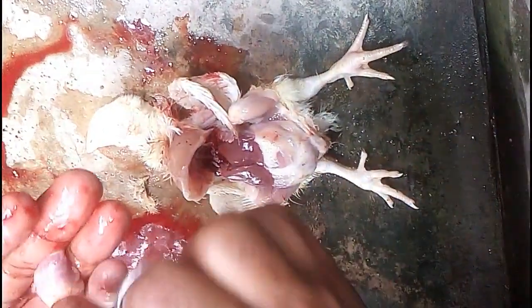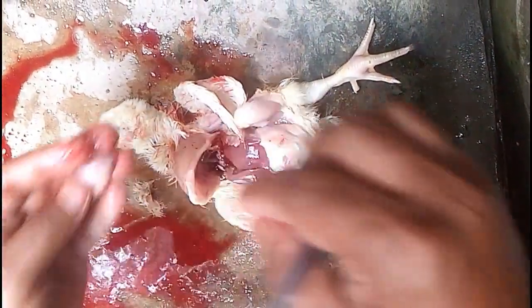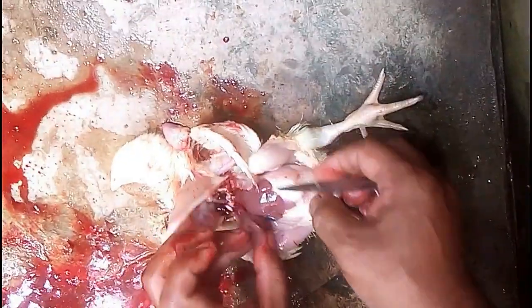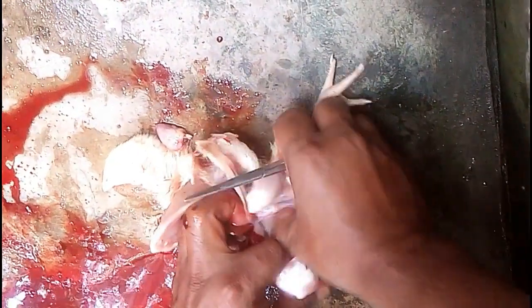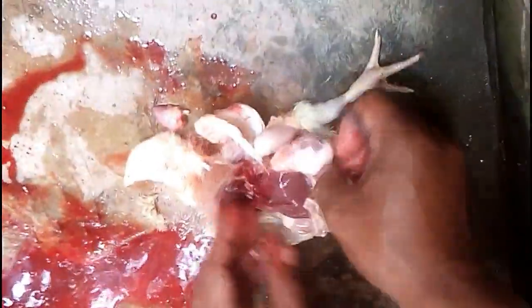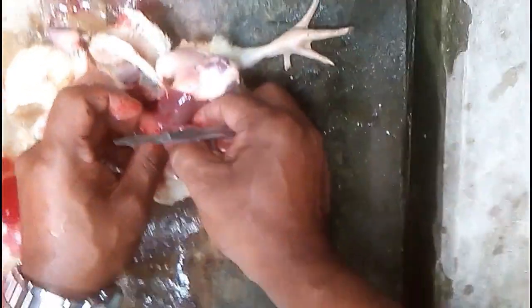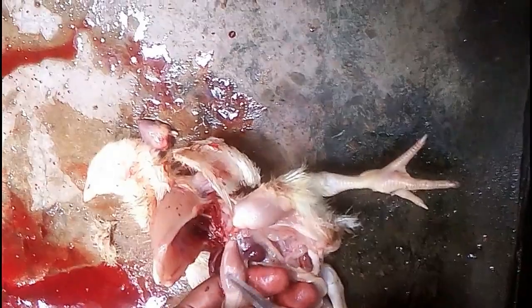Because it is slippery, we can say that it is caused by colibacillosis. Next, we try to find out other post-mortem signs or abnormalities of the bird.